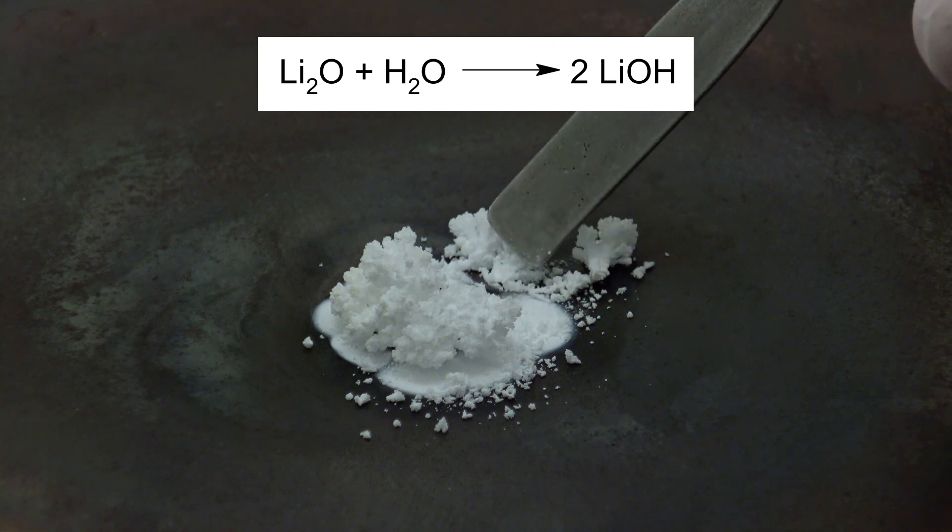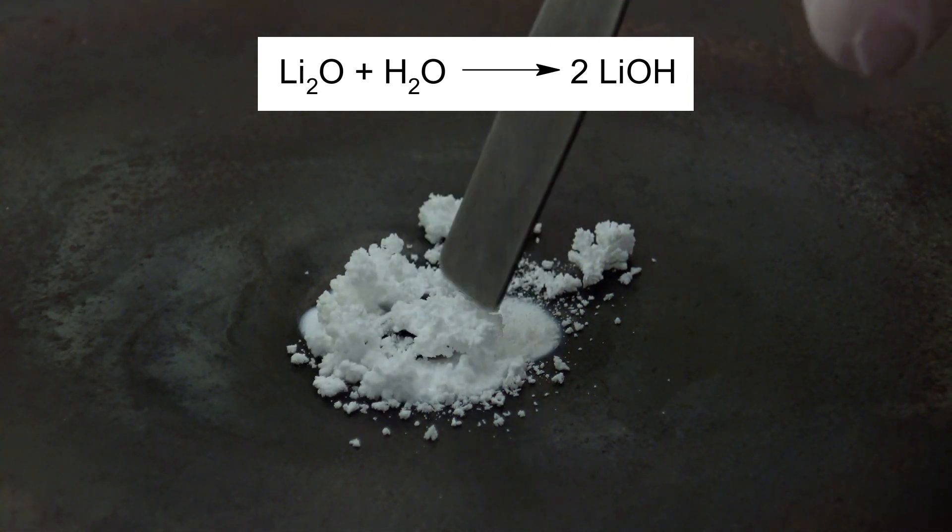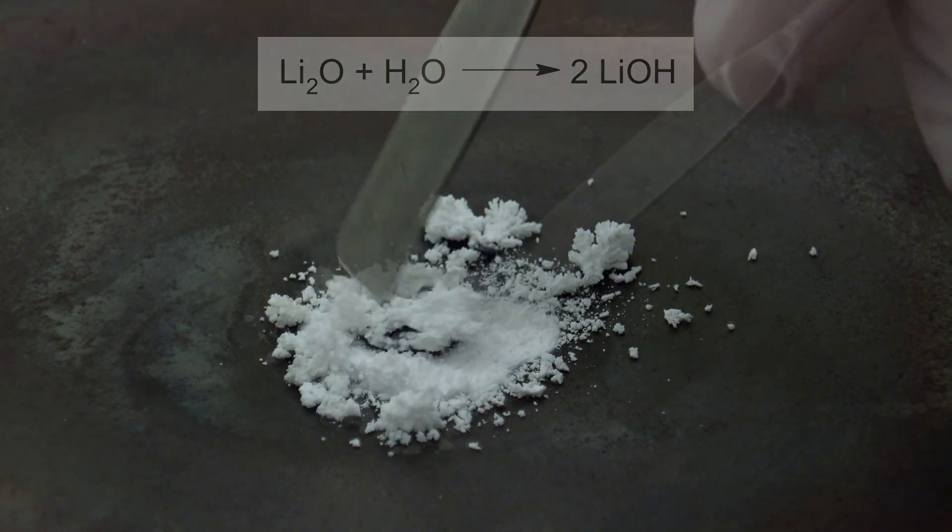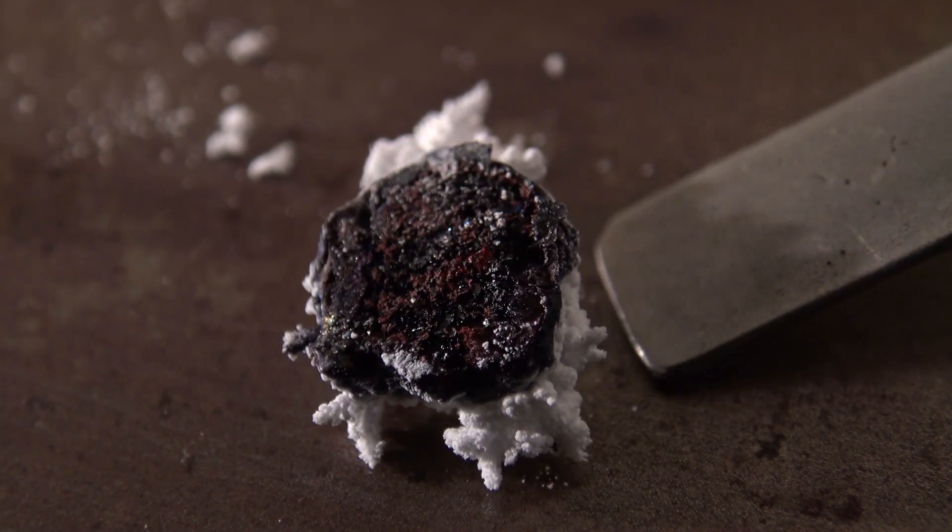Lithium oxide also reacts with moisture from the air to form lithium hydroxide, but it's not as hygroscopic as the hydroxides of the other alkali metals. What was even more interesting was that small crystals had formed on the bottom of the dark solid.